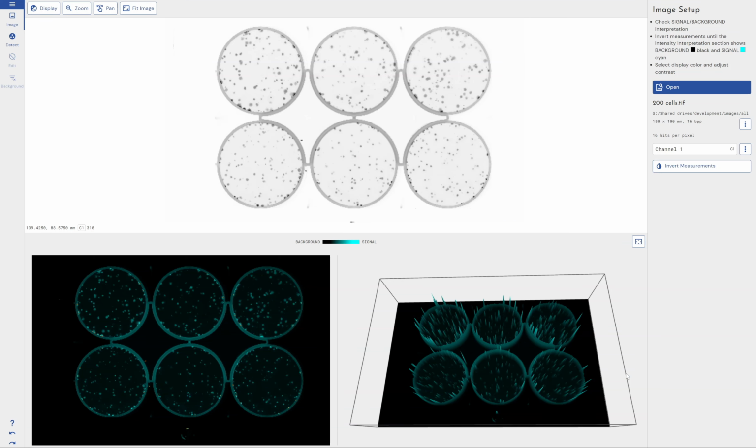Hello everyone. So today I'm going to be guiding you through how to analyze an ELISpot experiment using our Phoretix Colony Counter software. Now, Phoretix Colony Counter, as the name suggests, was initially devised as a colony counting piece of software, but it also does spot counting and it will do spot intensity and things like that. So it can still be applied to ELISpot experiments.